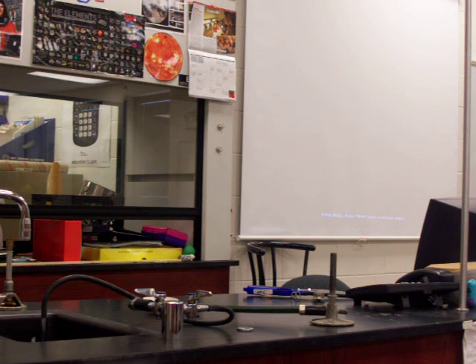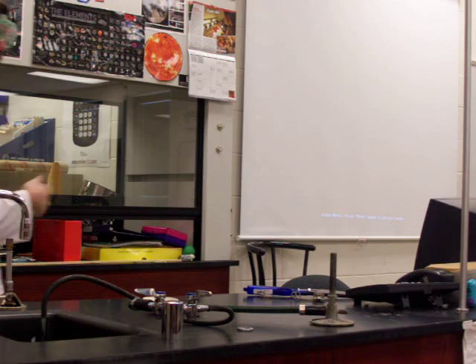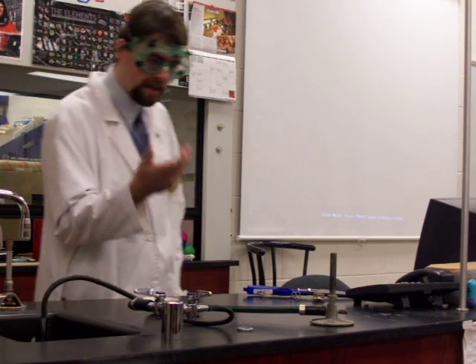Anyway, we're going to look at how to use a Bunsen burner today. Technically, some burners that we use are not actually Bunsen burners. They have a different name because they have a couple extra adjustments that weren't on Bunsen's original device. But this is the basic Bunsen burner here.